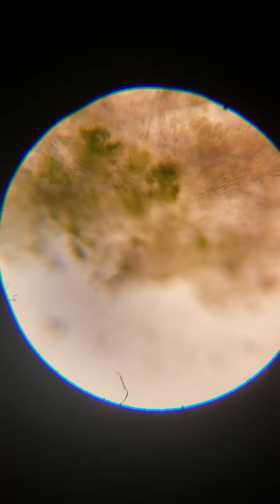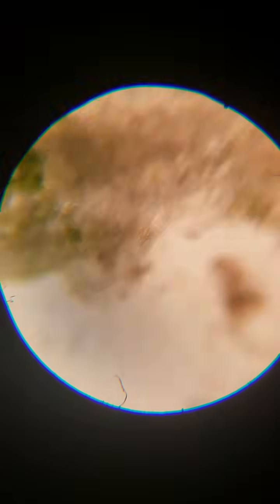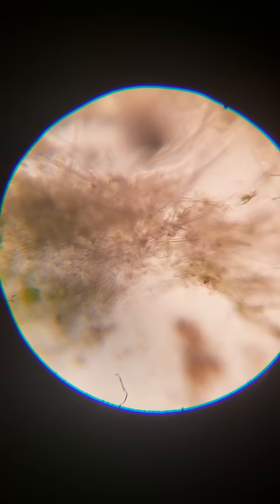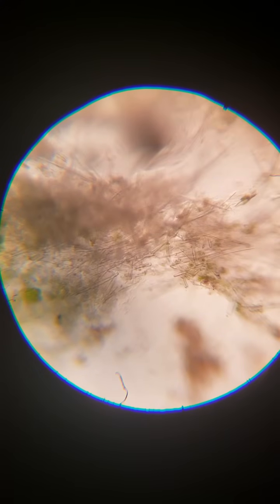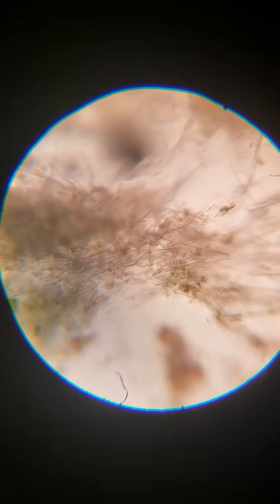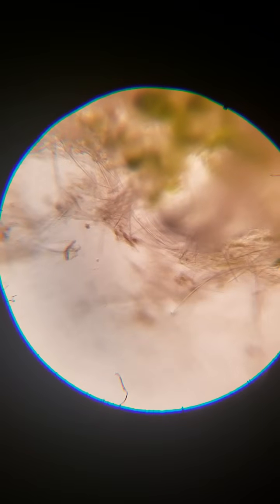So I'm going to kick it up, boom, a notch, where you can actually make out the cells in the sponge that are algae and not sponge. And here, take a look. This is the freshwater sponge. It looks like fiberglass. So take a look at that one sec. I need to change another setting. All right, so here we're zoomed in over 100 times, and you can see the structure of the sponge.